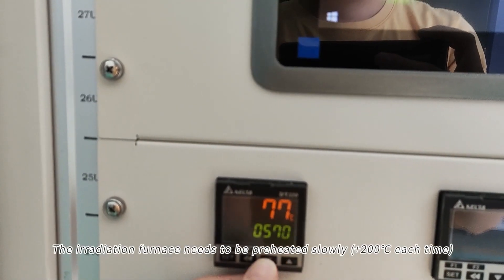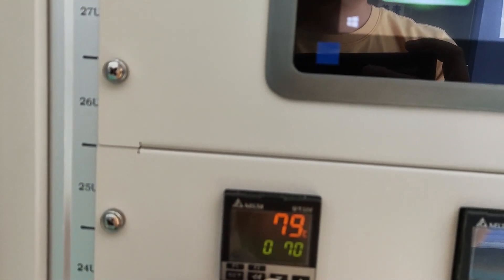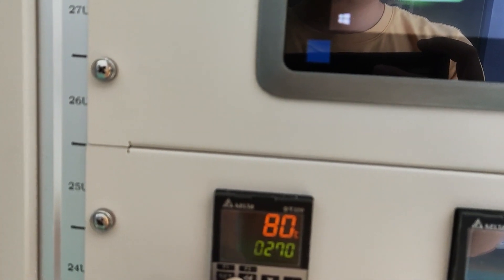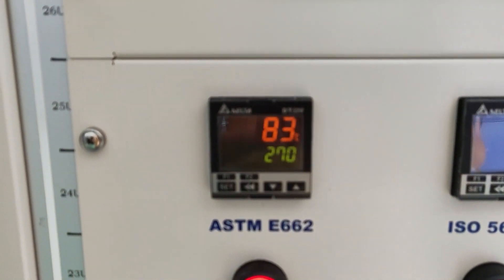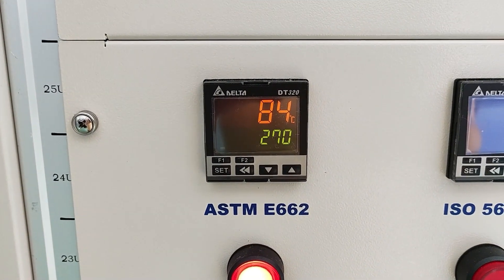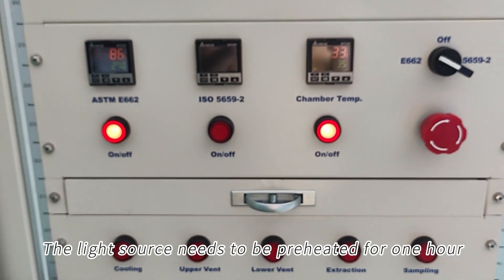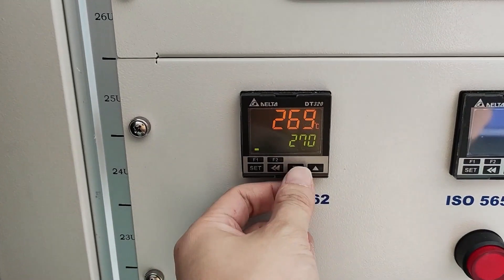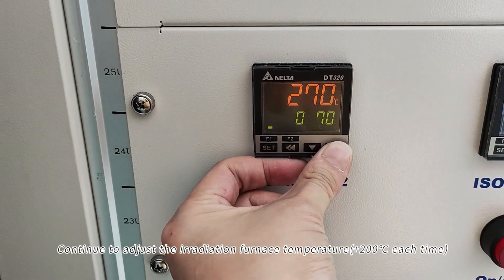The irradiation furnace needs to be preheated slowly. The light source needs to be preheated for 1 hour. Continue to adjust the irradiation furnace temperature.